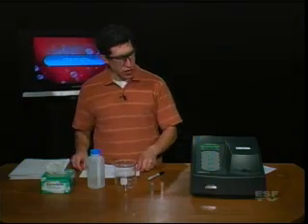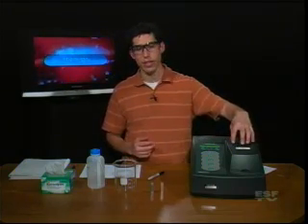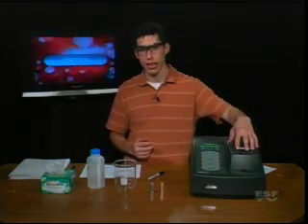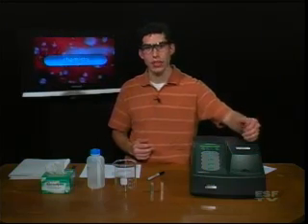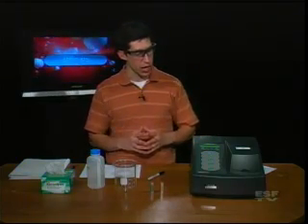The way a spectrometer works is by having a light bulb inside of it, which is placed right over here. And then we're going to put our solution in the way, and then there's a detector on the other side, and whatever it measures is the light that comes in versus the light that comes out. And the way it measures that is using absorbance, which we'll talk about in one second.